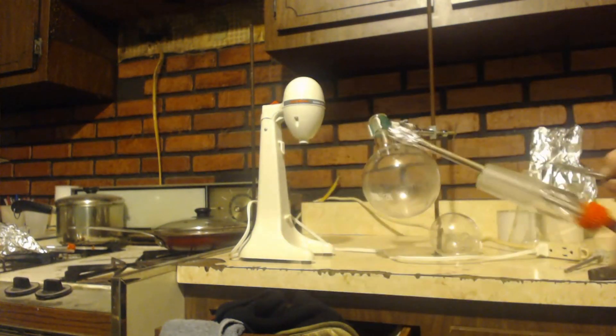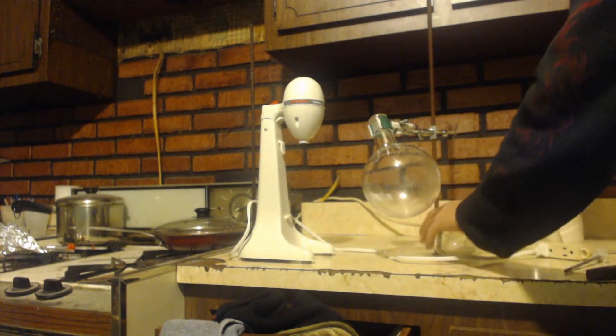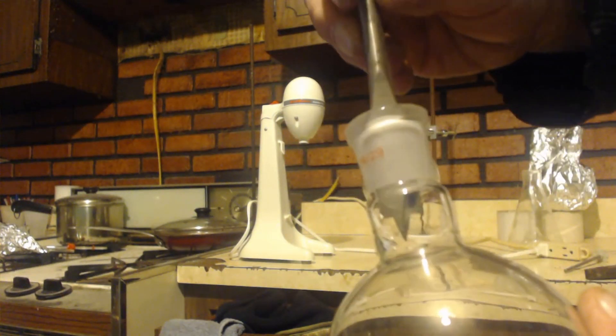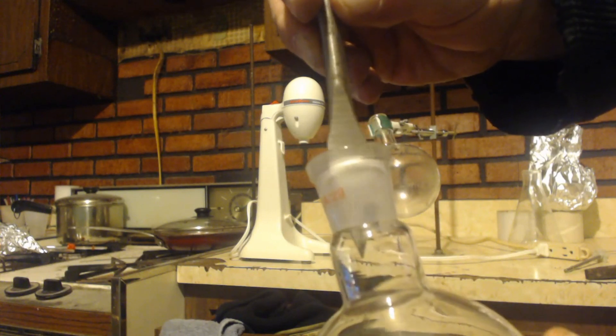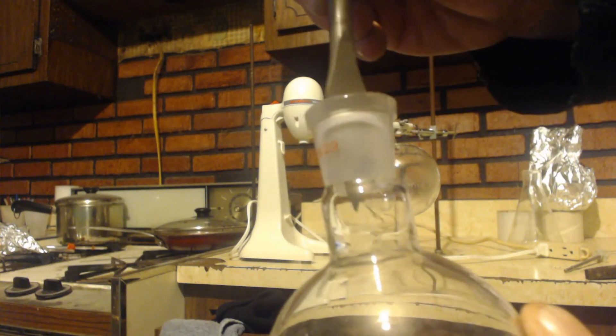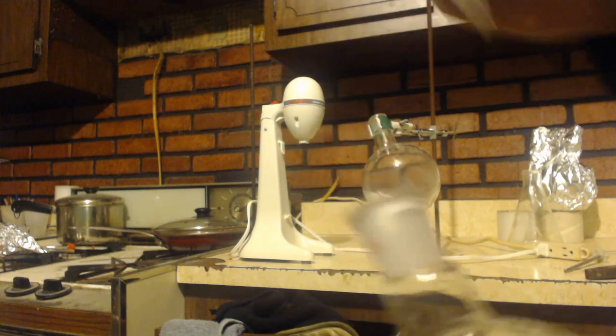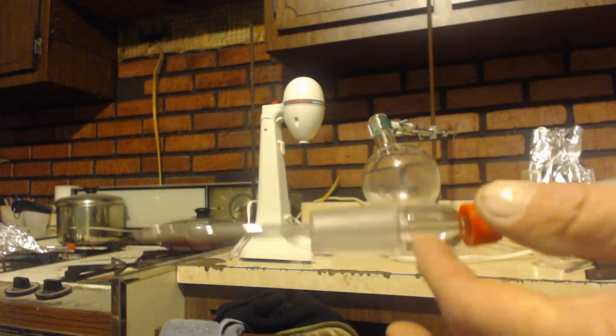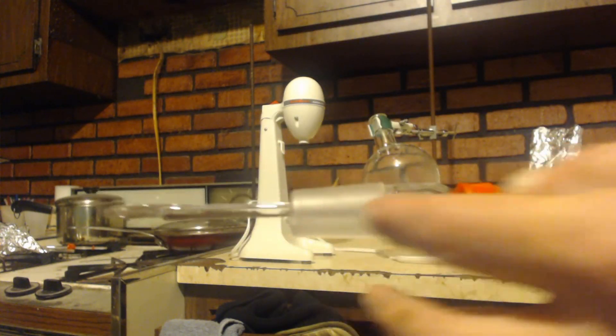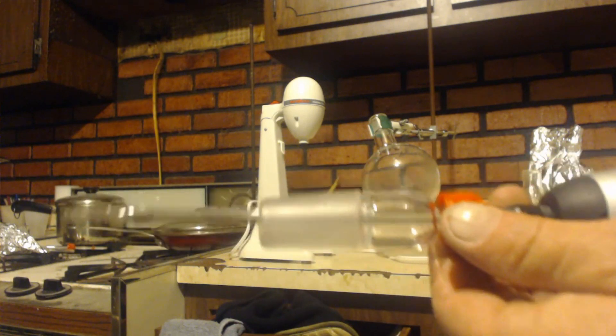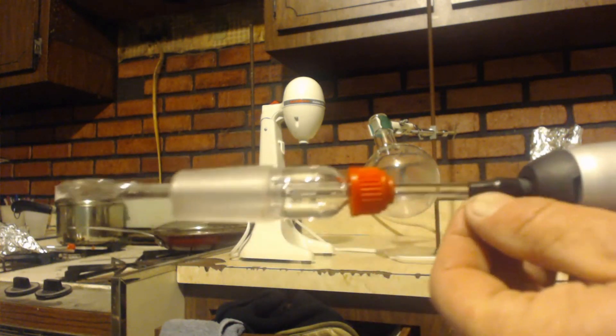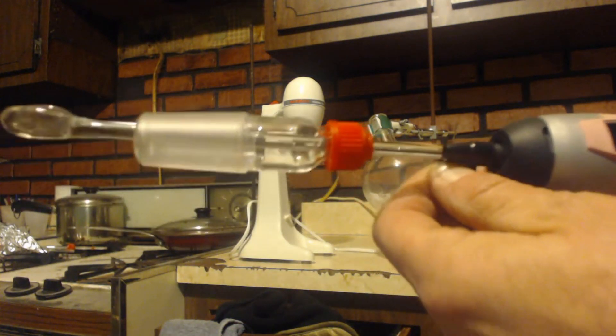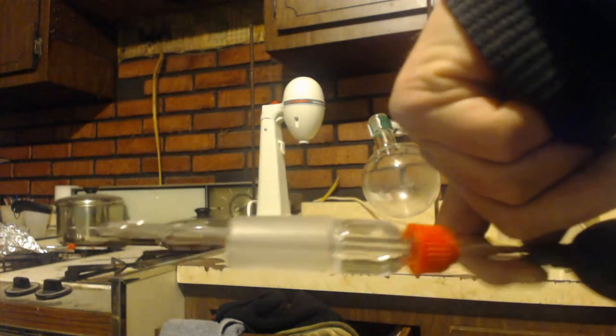Because look, this piece here, look how much bigger it is. It's about a millimeter bigger than the glass, and this has another millimeter to leeway when it's inside here. That's the fattest part and look how much it moves back and forth. This is just for a thermometer thingy, this thing here, but it's good for hoses and for this.